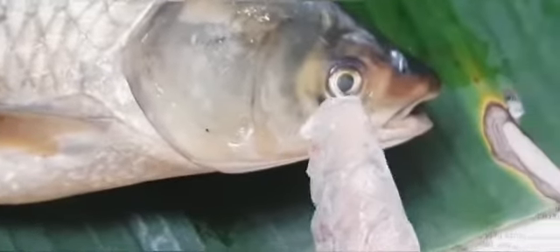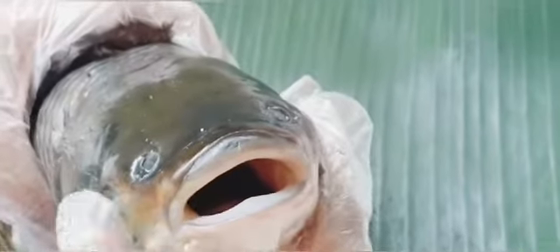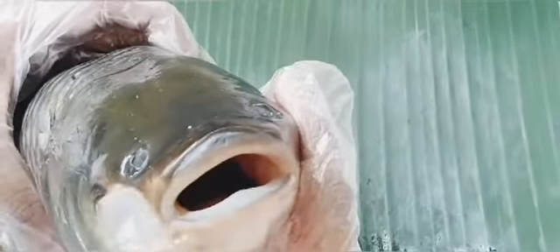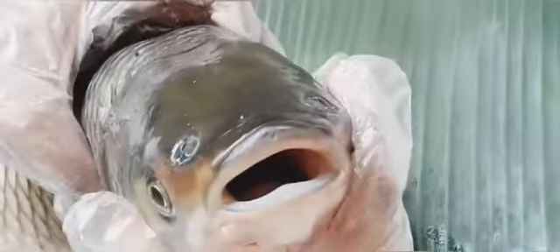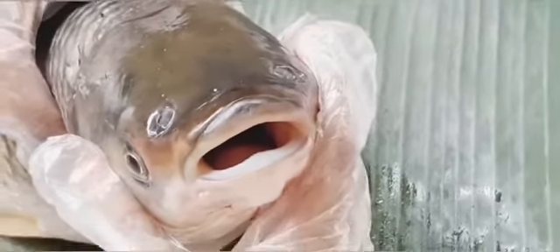And these are the eyes. It is similar to that of the human eye. And if we see its mouth, generally it is not seen. We cannot see the presence of any jaws, but if we feel inside it, then we will see the presence of a small number of teeth. So we can say that it has jaws, but it is not quite visible to us.